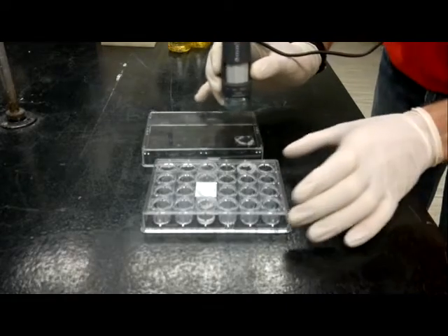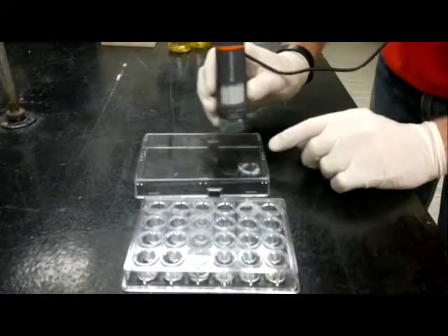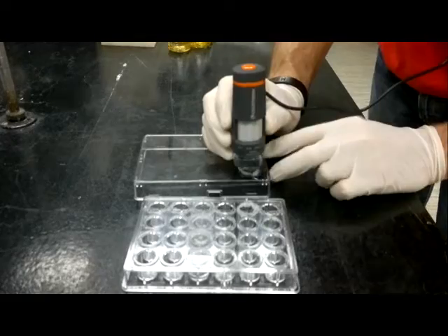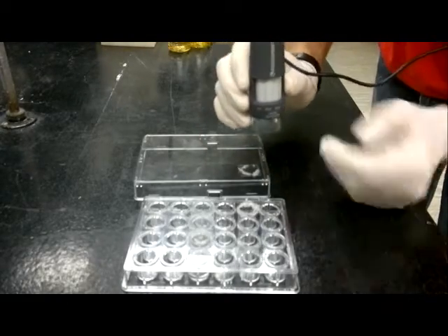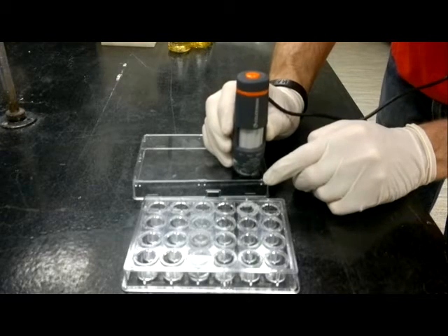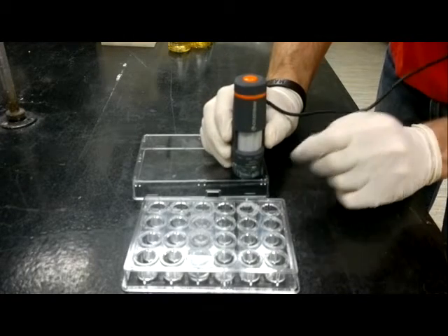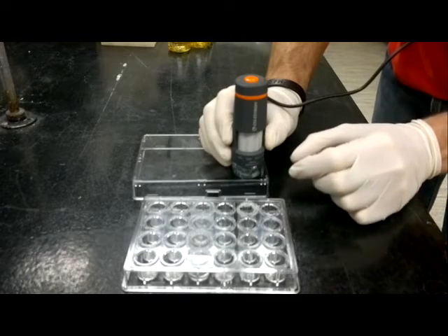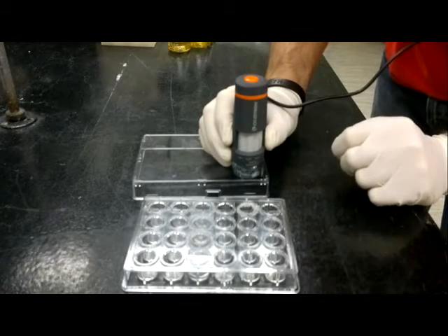...and this does get a little gooey because, of course, there's the petroleum jelly on your cover slip. You simply place, and it will be lit up when it's plugged in the USB port. Place the microscope over top of the cover slip. The field of view is large enough that you should be able to see most of your drop at this point.